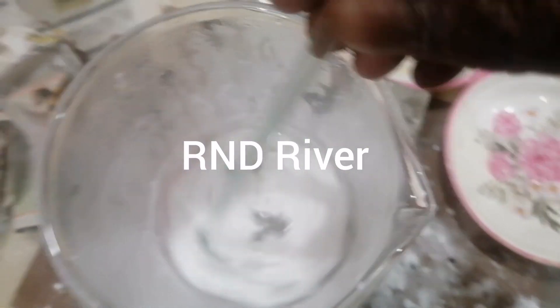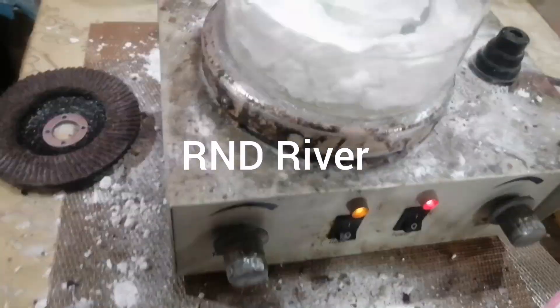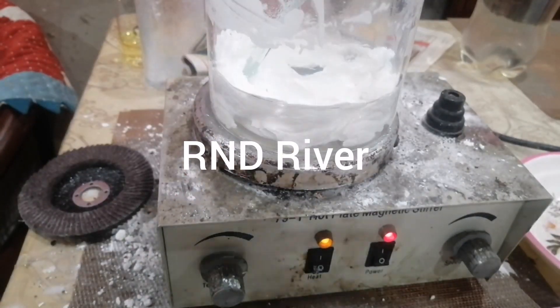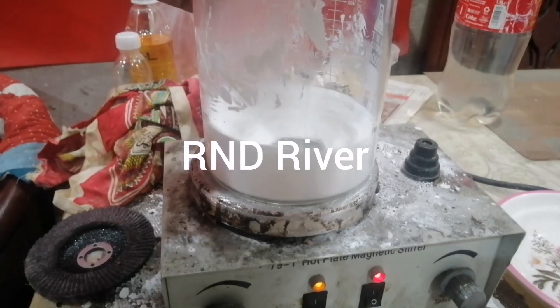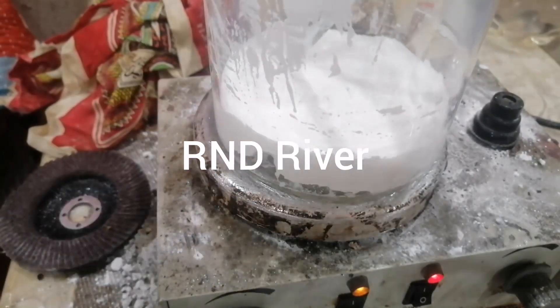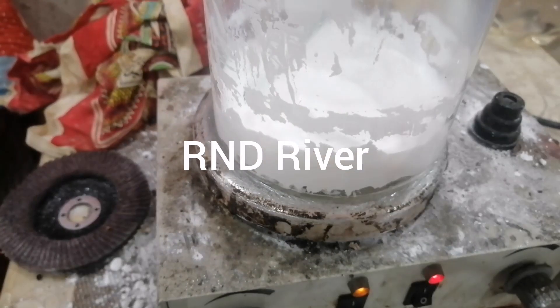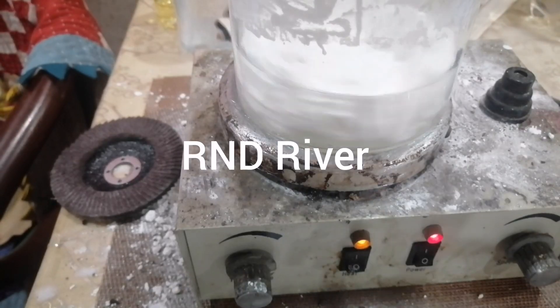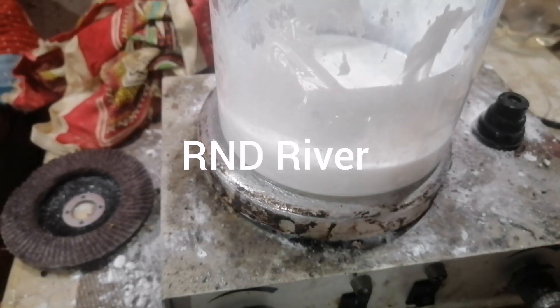This is near to finish. We have to raise the temperature between 95 degrees centigrade to 100 degrees centigrade to remove all moisture. The stirrer must remain active during the whole process — do not stop the stirrer at any time.